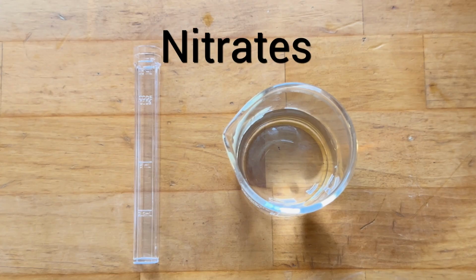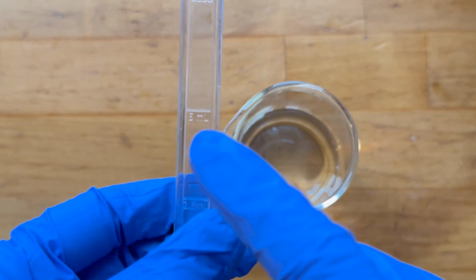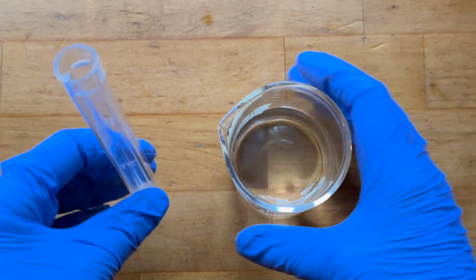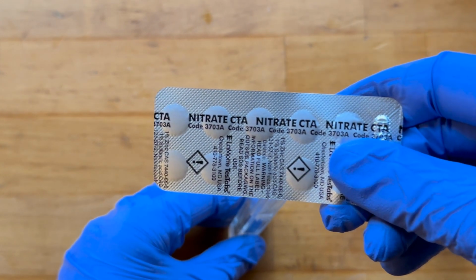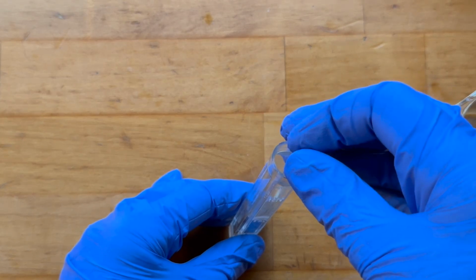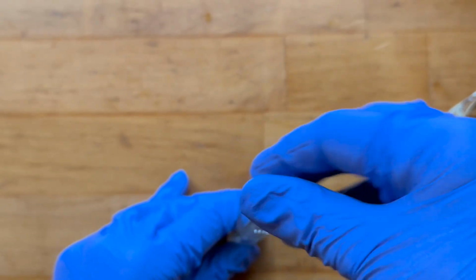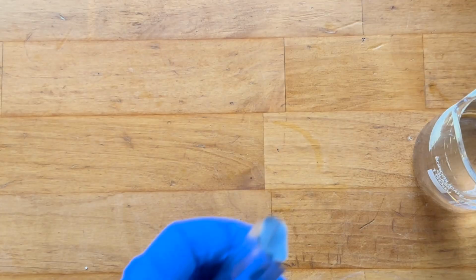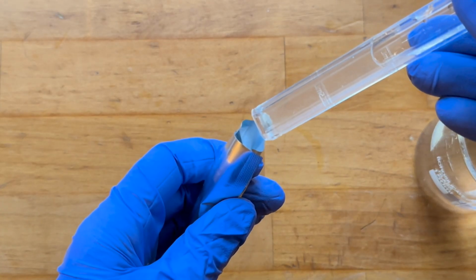So for the nitrate test, what you want to do is fill the test tube to the 5 milliliter line in one of the plastic tubes. It's right here with your pond water. Then what you're going to do is add 1 nitrate test tab. Just check and make sure that what you have is the nitrate. Cap it. And then what you do is open the tab and put in your tube.